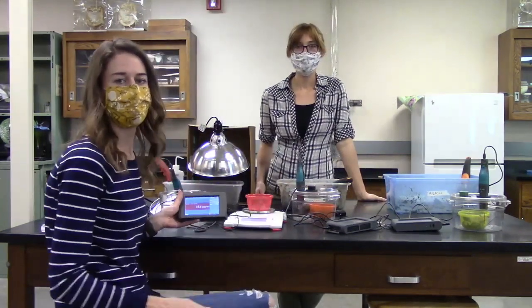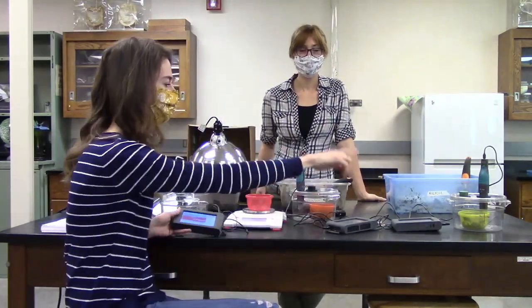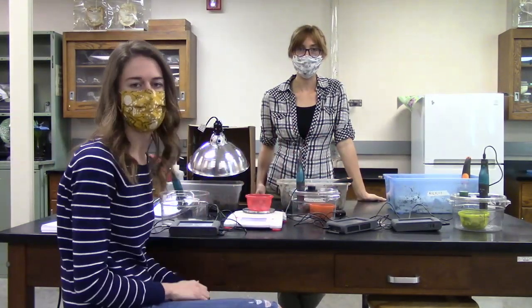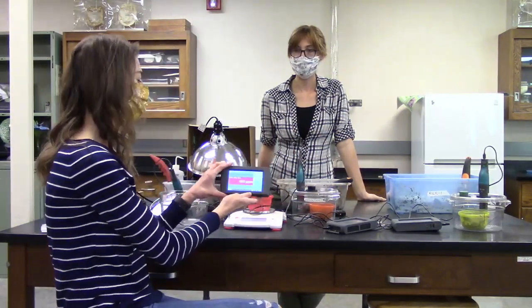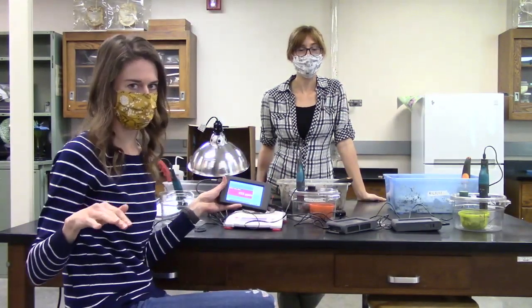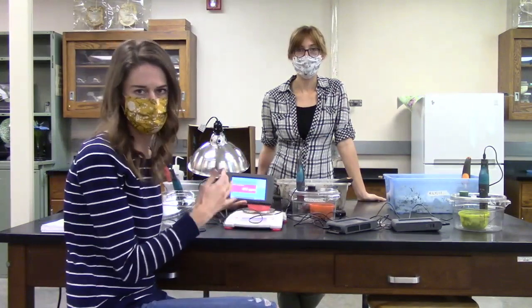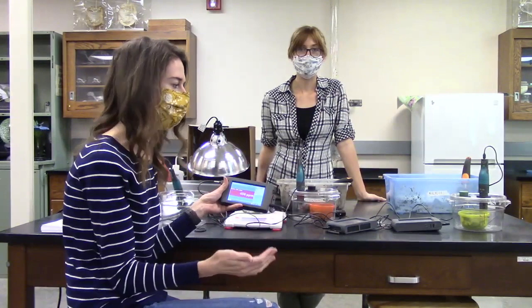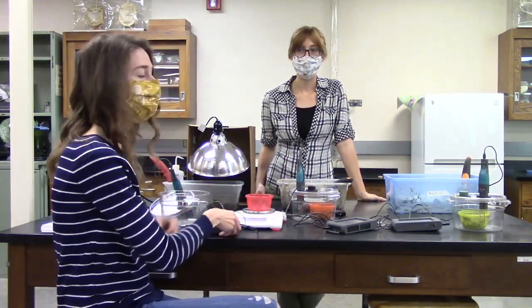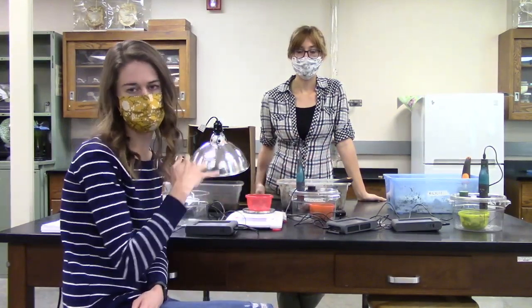Okay, so Lindy and I have gotten the first couple ready to go. We have our dry soil on the end of the counter here, and we have our wet and cool soil in the middle. And then finally, we're going to add the warm and wet soil. For each of these, we want to make sure that our CO2 sensors are at approximately the same level before we start, so we know that we have a solid baseline for all of them. There is always some fluctuation with these things, but for the most part, they're all around 450 parts per million for CO2 before we get going. So we had them all in the closed chamber just to stabilize and calibrate them.